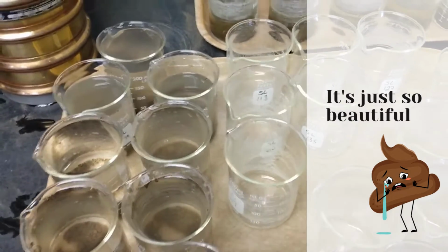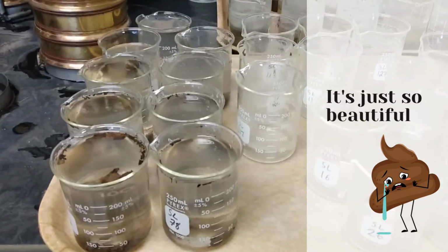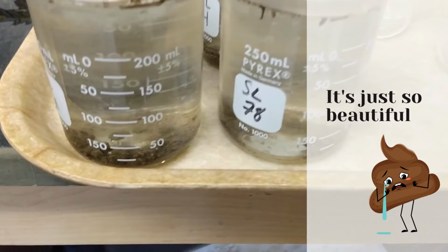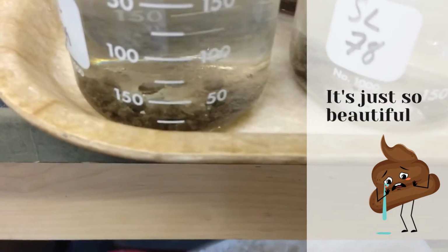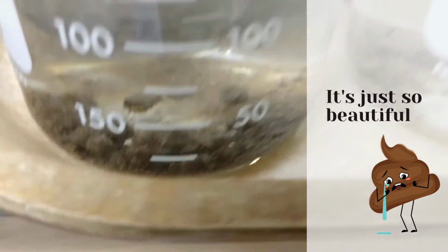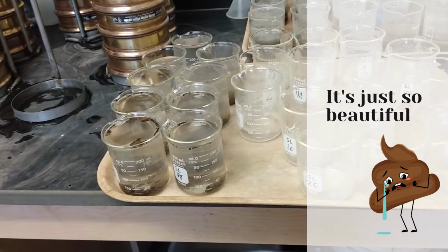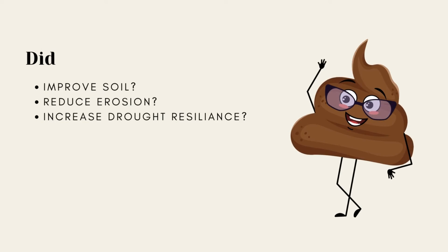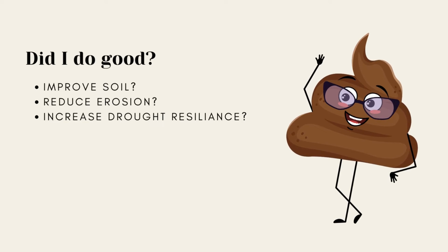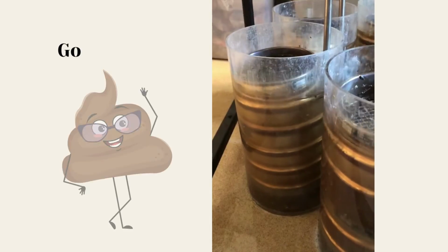The bigger the mean weight diameter is, that means there was a higher average particle size that was stable in water, stronger aggregates. We'll be able to use that information to tell us whether the treatments that we originally applied to the different soil samples are helpful to improving soil, reducing erosion, and improving drought resilience, all from this one little shaker.